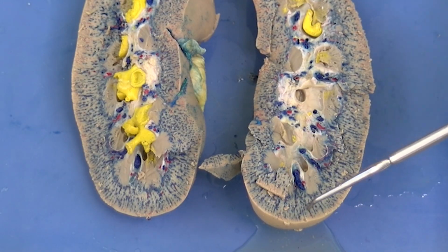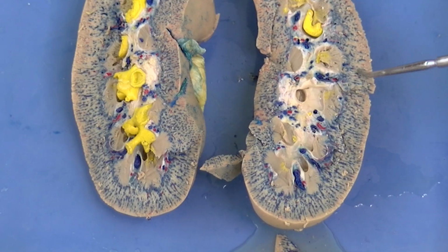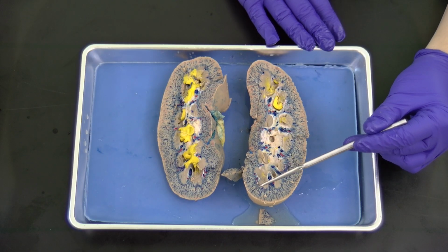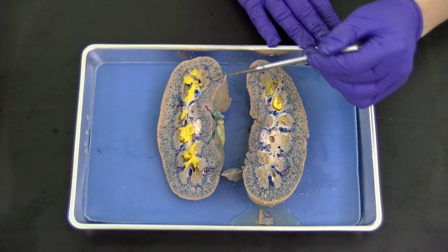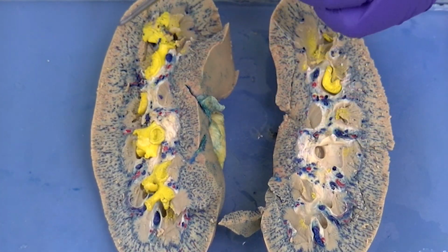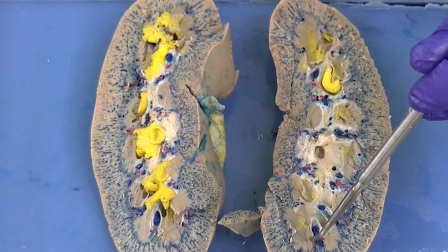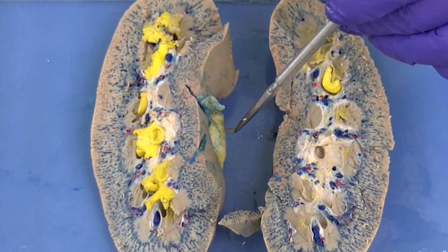This is really one of the main functional areas of the kidney. You're going to see that we have lots of dye here in the cortex, and that represents those blood vessels. Specifically, we're seeing a lot of venous activity, so this is going to drain the kidney. We don't see the red as well here, but we do maybe on this particular side. We see a little bit more of the red, and that's going to be the arterial blood that's making its way in for filtration. And then it makes its way back out, and then through the larger vessels, and then out through the renal vein, which we had looked at.